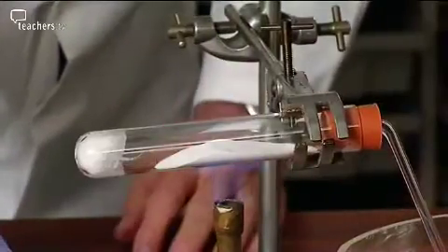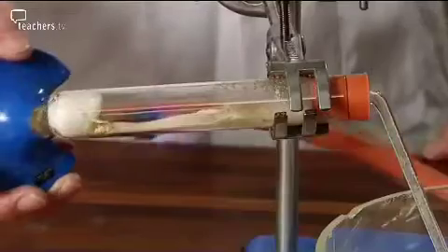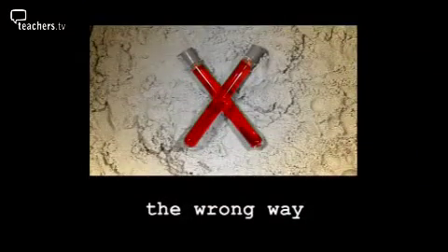Now the idea of the experiment is that we heat up the aluminium oxide until it's really hot, and then we vaporise some of the liquid paraffin, which then moves over the aluminium oxide. It's broken down into a gas, and then it will escape through the tube at the end here. Wow, it's already starting to bubble. Would you like to start collecting then? What we're collecting here are gaseous hydrocarbons. The problems begin either when the heat is removed or when the paraffin is used up.